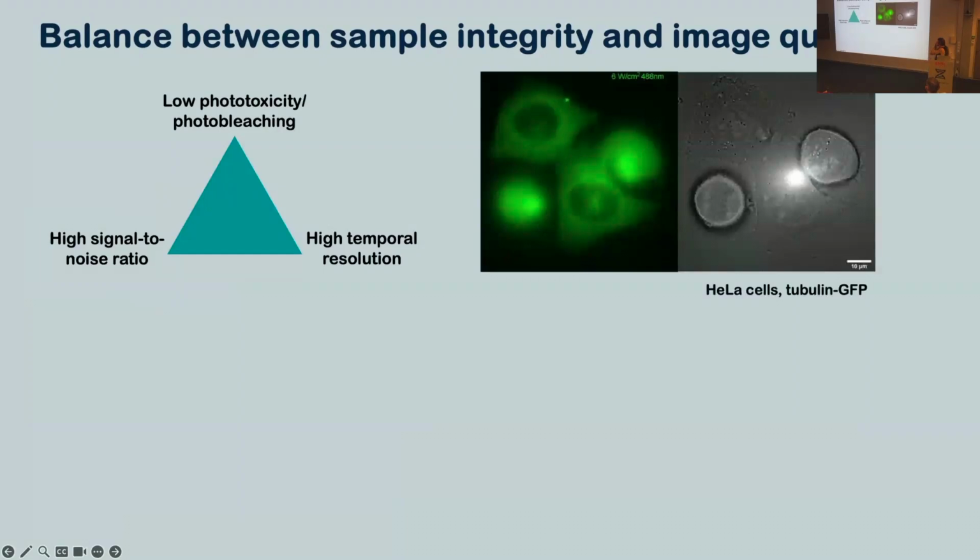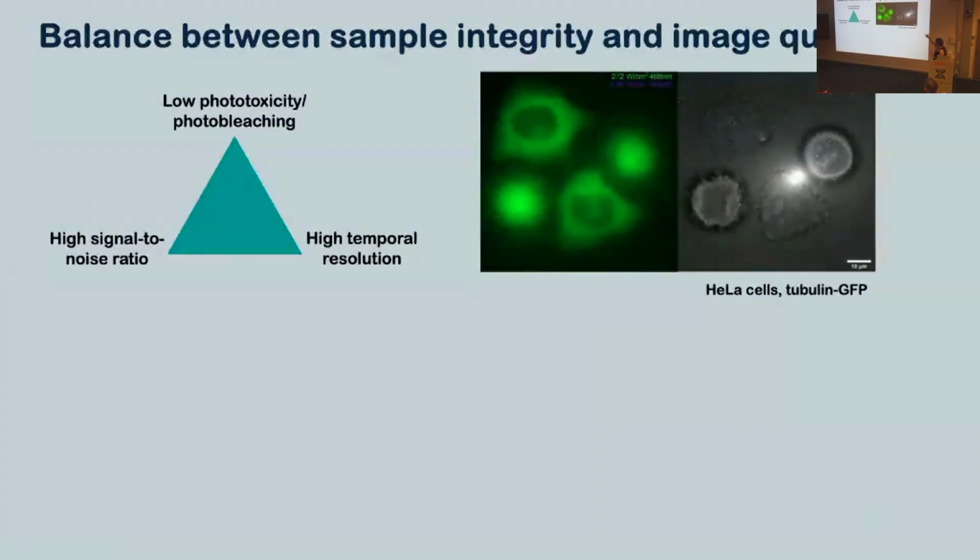So this is a video of the same cells in two channels. The left is the fluorescence channel, we've got tubulin GFP, and the right is just the transmitted light. And all I'm going to do in this movie is image these live cells, and I'm just going to turn up the laser intensity, and we'll see how they feel about it. So here we go, turning up the laser intensity. Things are fine to begin with, but then, if we look at the transmitted light channel, you'll see the mitotic cells are blebbing, that bottom cell is really retracting, and this has happened within 12 minutes. I've been incredibly violent here, unnecessarily violent, but too much light really can kill your cells.